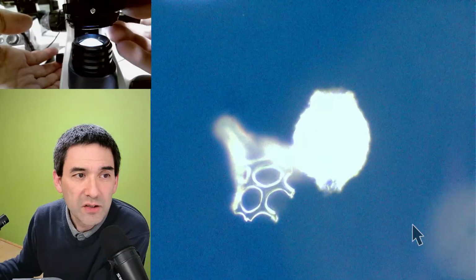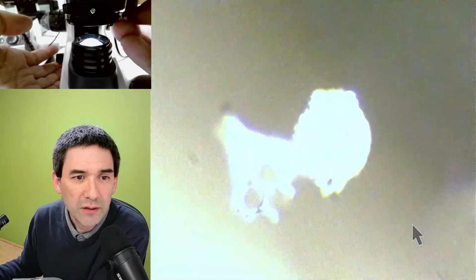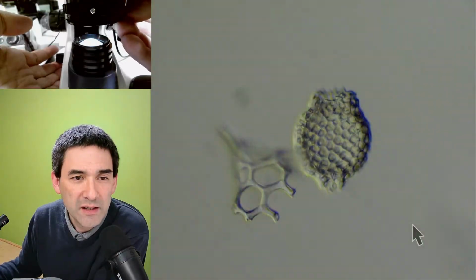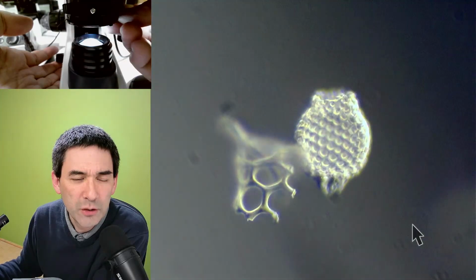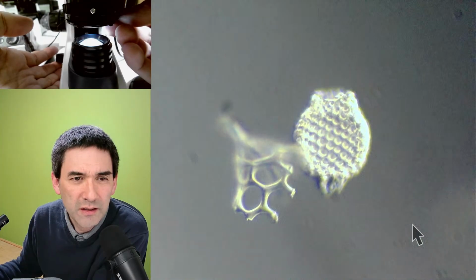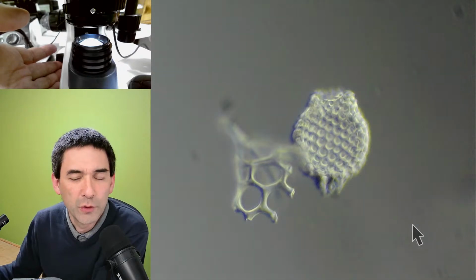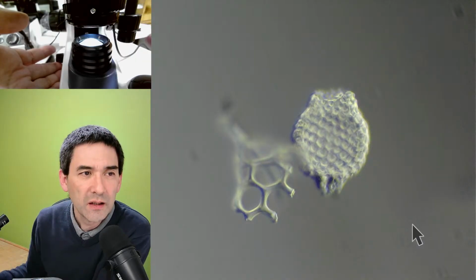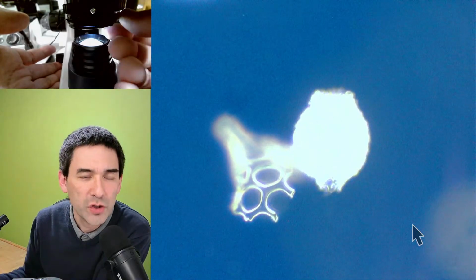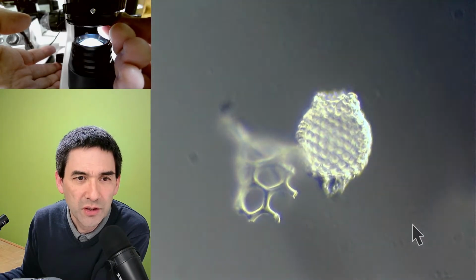So let's swing it out a little bit again, and when you swing it out, that's a little bit the thing that I discovered. Look, the color doesn't seem to have a huge effect. That's the interesting thing. When you push it in completely, then it's blue. But if you push it out, the color doesn't seem to have a huge effect here. That's an interesting phenomenon, something that I kind of discovered. So the color is good if you just want to do Rheinberg illumination, if you push it in all the way. But as soon as you go oblique, for whatever reason, the color is not evident anymore.